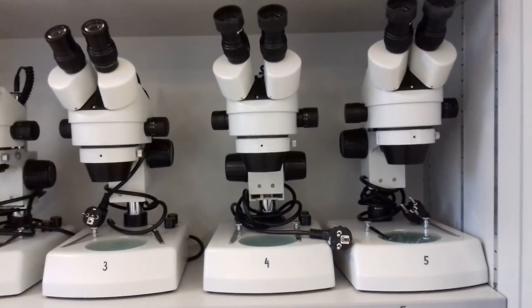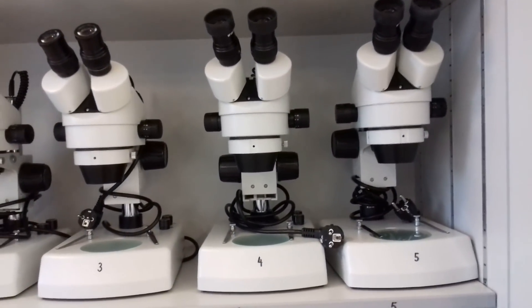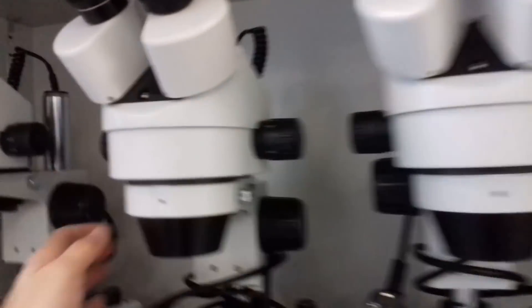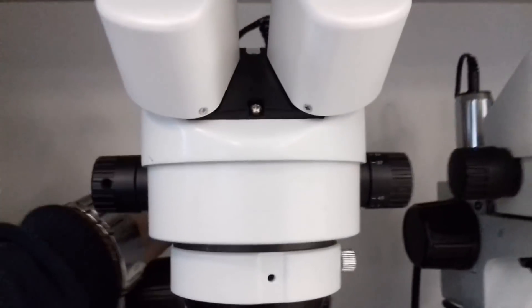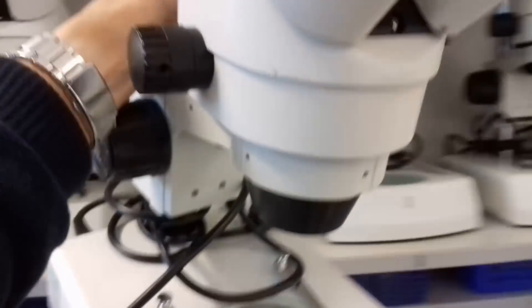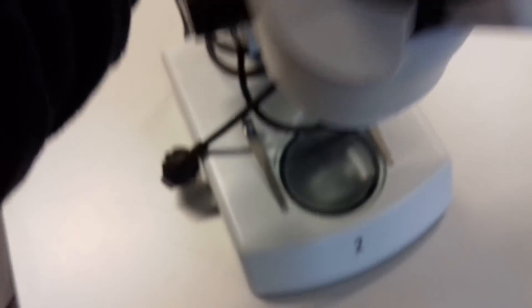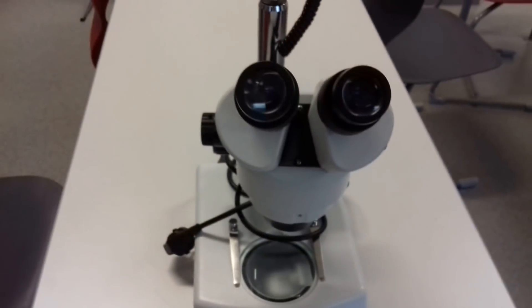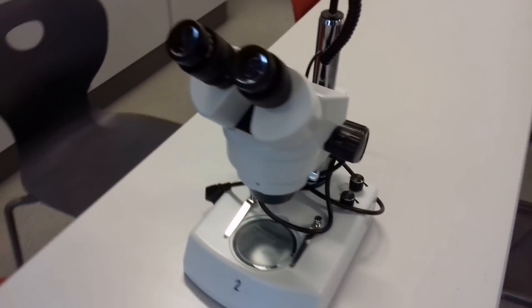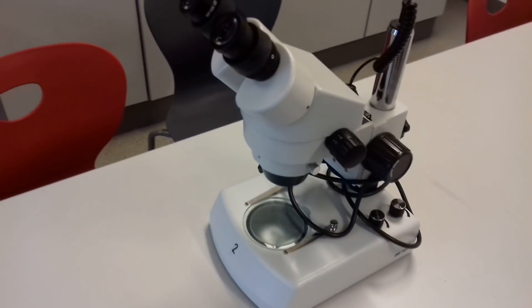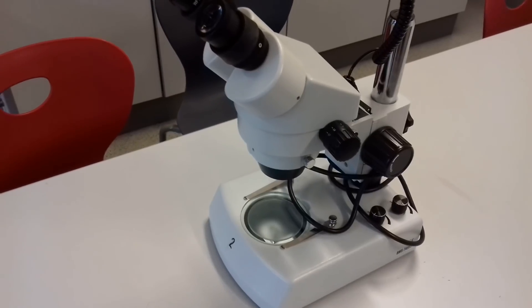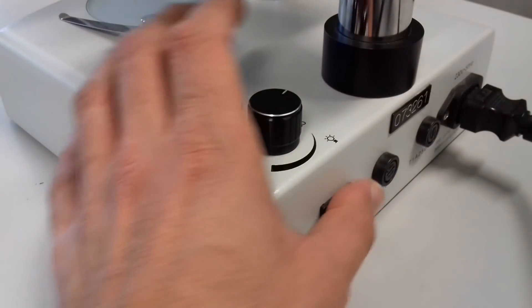Well, we've got I think around 10 of these stereo microscopes, they're pretty high quality, and I'm going to do the following. I'm simply going to take one of them right now and I'm going to have a closer look at them. There is no brand printed on the microscope, but even though it is a no-name microscope, the quality is quite high.